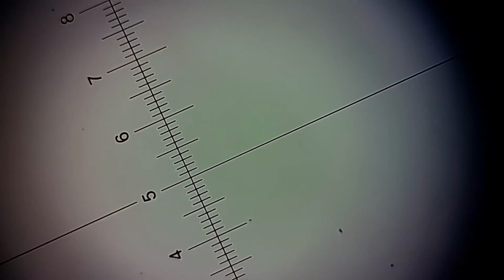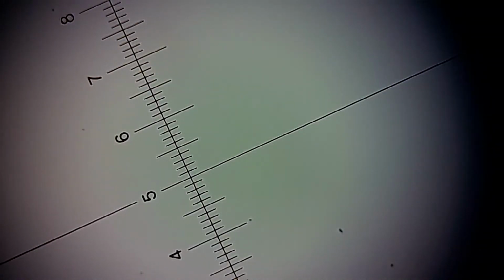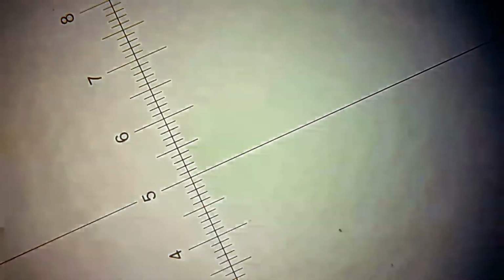This is the light disperser. I changed it. I removed the cap, there's a cap for the light disperser. Now we're going to use the leaf. There's nothing on the microscope now. We're going to put the 4 times on the objective lens. This leaf was green yesterday, now it dried. So this is like 40 times zoom.